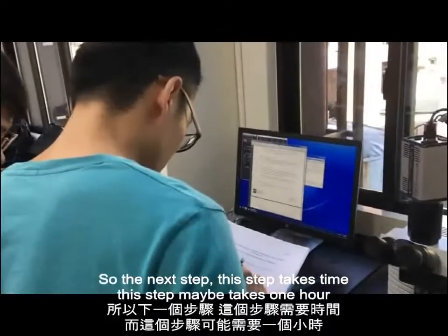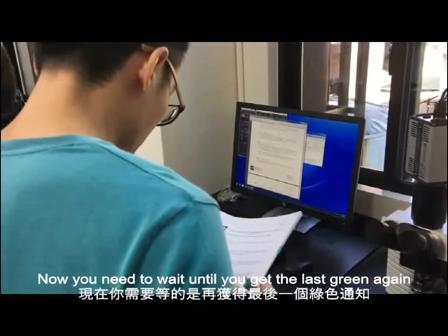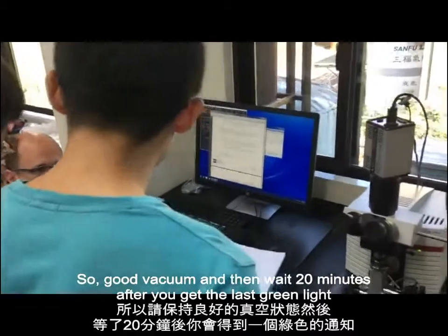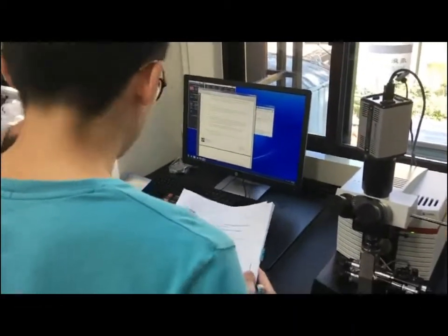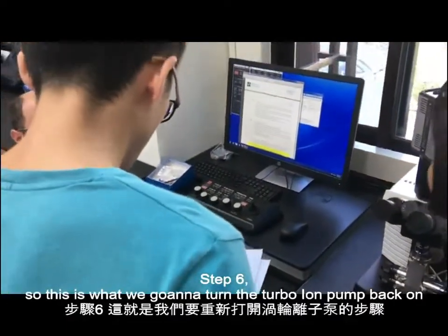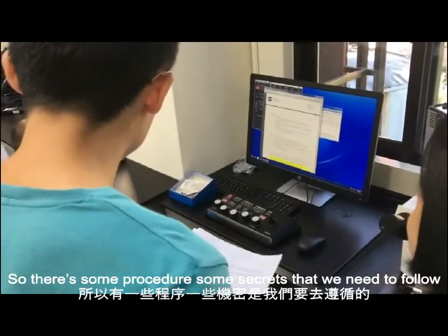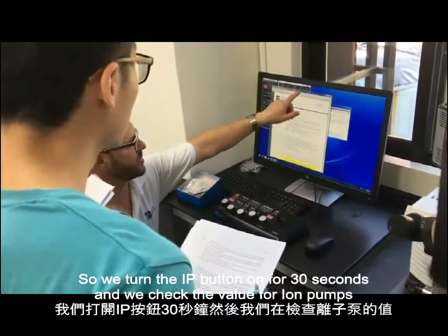So the next step, this step takes time. This step could take maybe 1 hour. So now you need to wait until you get the last green again, so good vacuum, and then wait 20 minutes after you get the last green light, so it can be even better. Okay? So that's step 5. Okay? Step 6, so this is where we're going to turn the ion pumps back on. Okay? So there's some procedure, some sequence that we need to follow. So we turn the IP button on for 30 seconds, and we check the values for ion pumps. Okay?